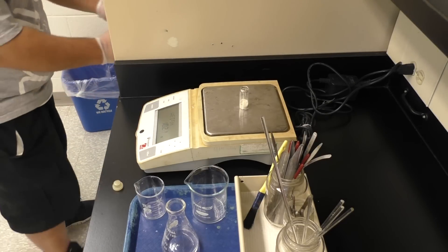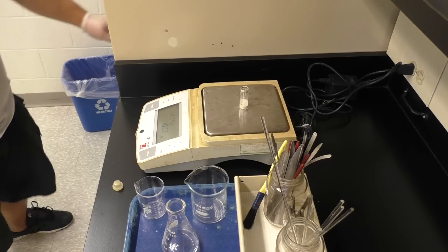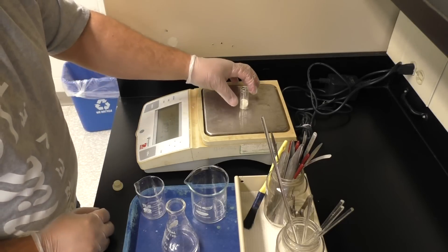If you're weighing it with the cap, close. When you go to take your final weight, make sure you have the cap as well. So record that mass of your unknown in the vial.